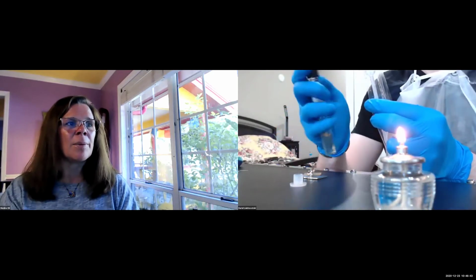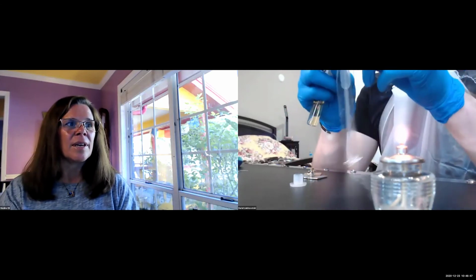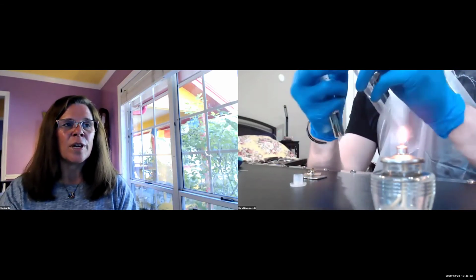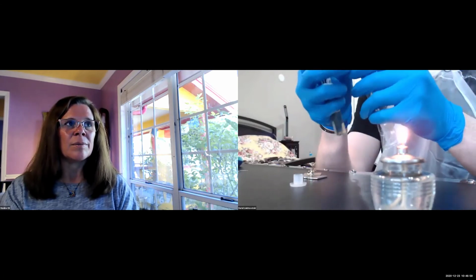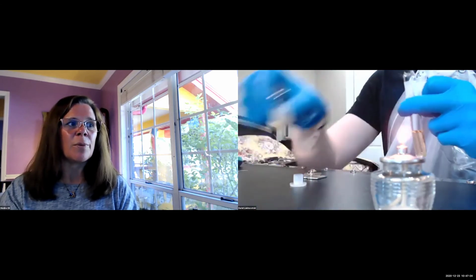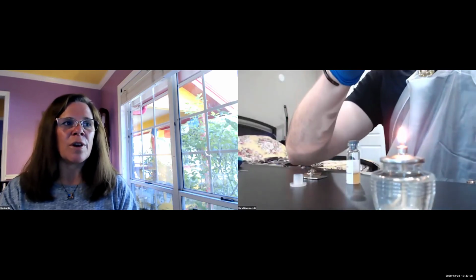Then open it up again and take everything from your dehydrated culture and transfer it into the liquid broth. So take everything, not from this tube, from the other one, because you want your culture to grow.